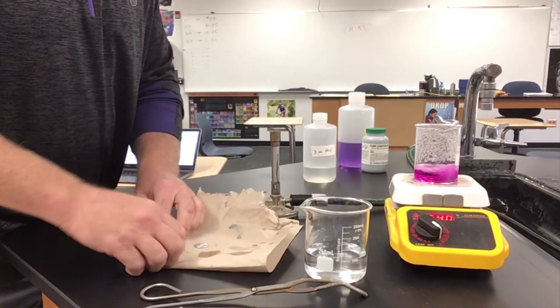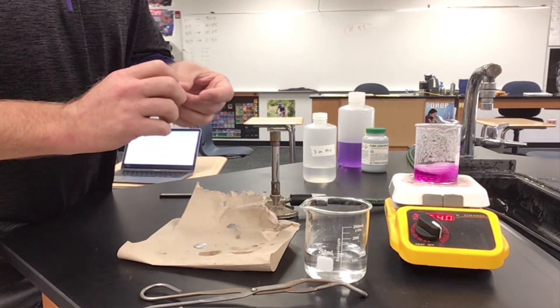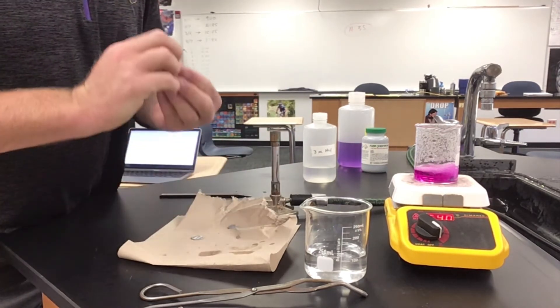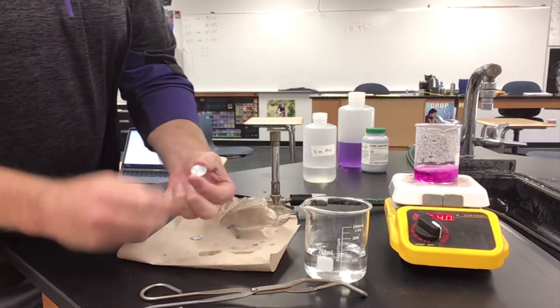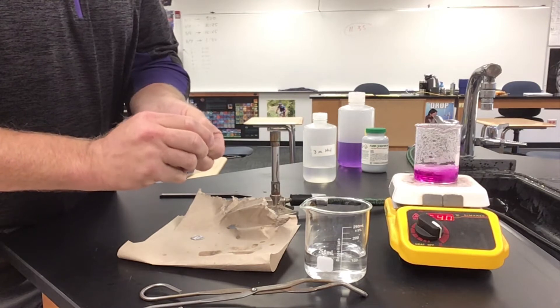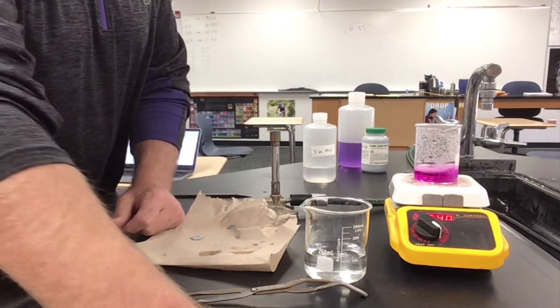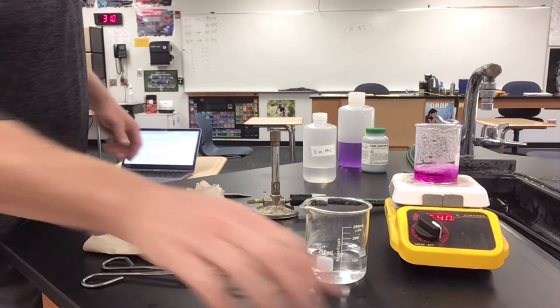We now have a really cool-looking silver penny. I'm going to leave one of these and not do the last step with it so we have a visual comparison at the end. So let's put that one off to the side for now and we're going to do the other one.